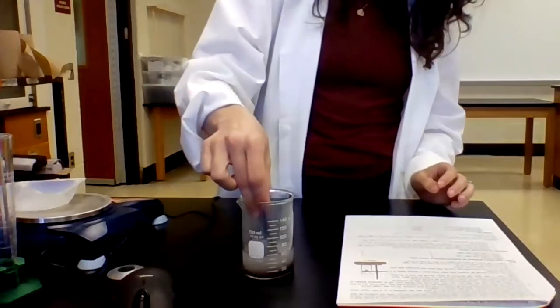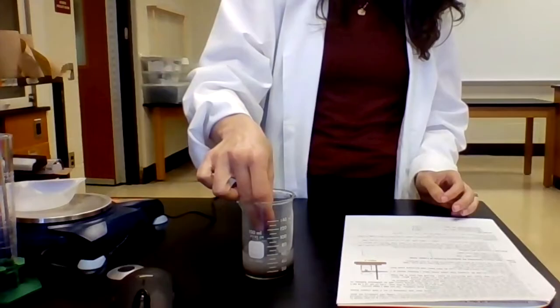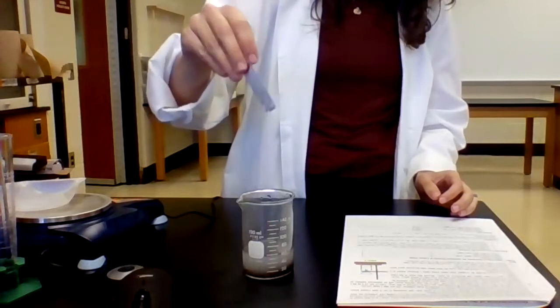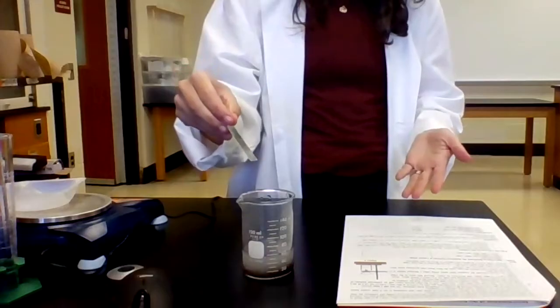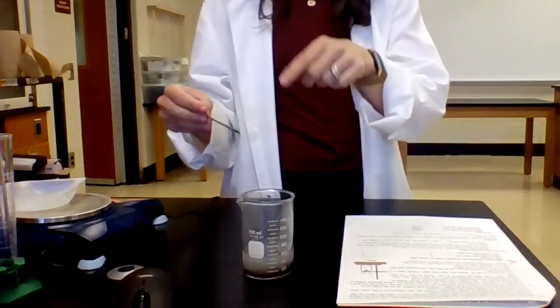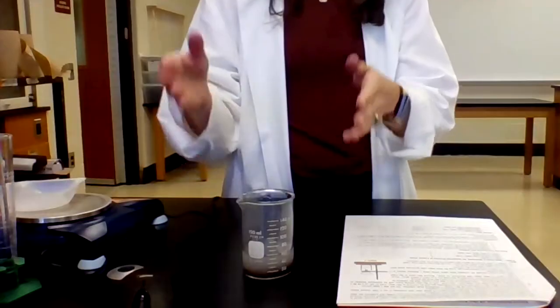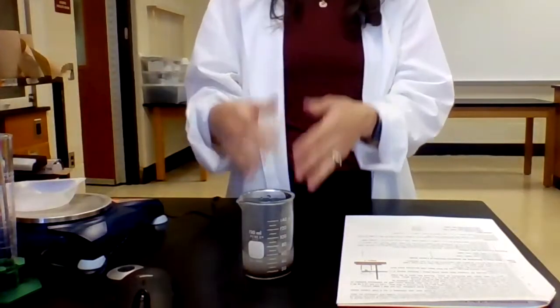So I'm just gonna dip this in, just kind of hold it, not a super long time. But what I see is, okay, nothing has formed on the copper metal, or sorry, on the zinc metal. So I know that this reaction is complete. And so now what I need to do is I need to quench the excess zinc metal that's in here. Because when I filter my product, I don't want it to be copper metal and zinc metal. I need it to just be the copper.